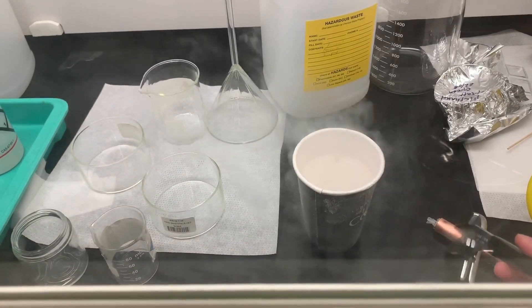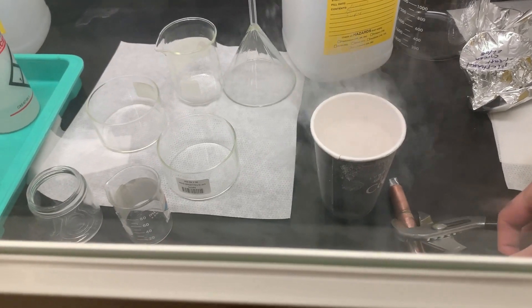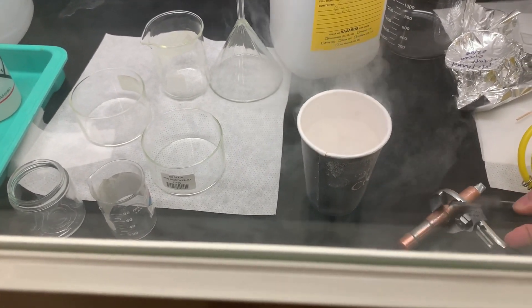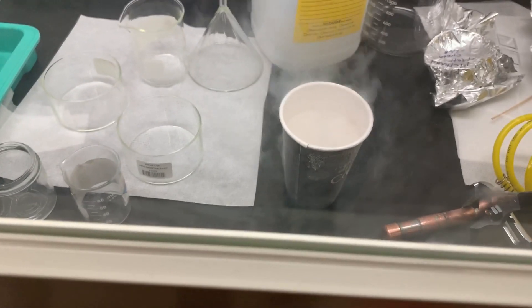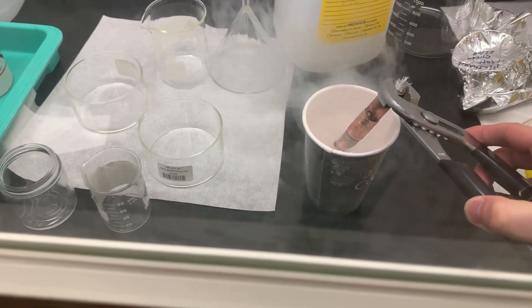There is a cup of liquid nitrogen and I've got the same setup not attached to the copper rod. We're in a fume hood now so that if the chlorine bursts and releases chlorine gas it'll get pulled away. Also there isn't hardly any in there so it's not a big deal.